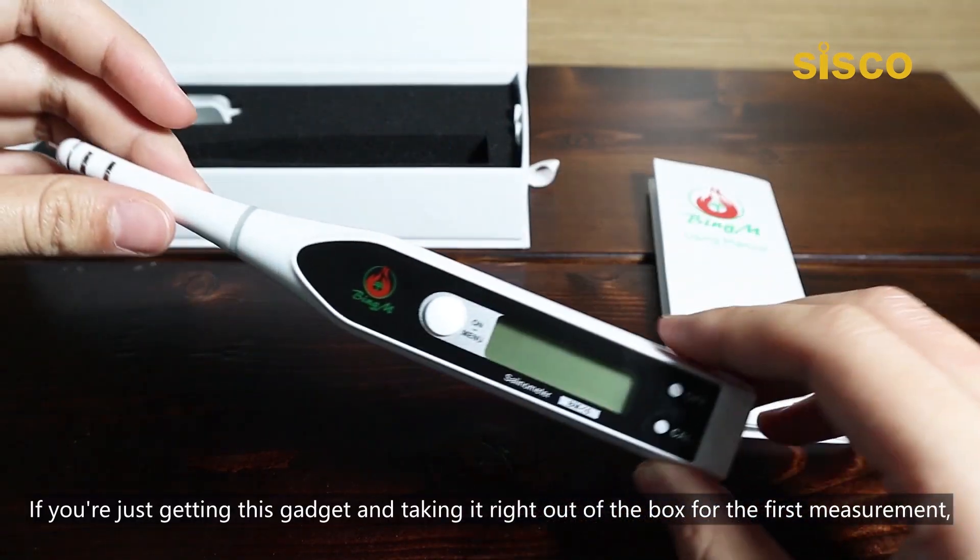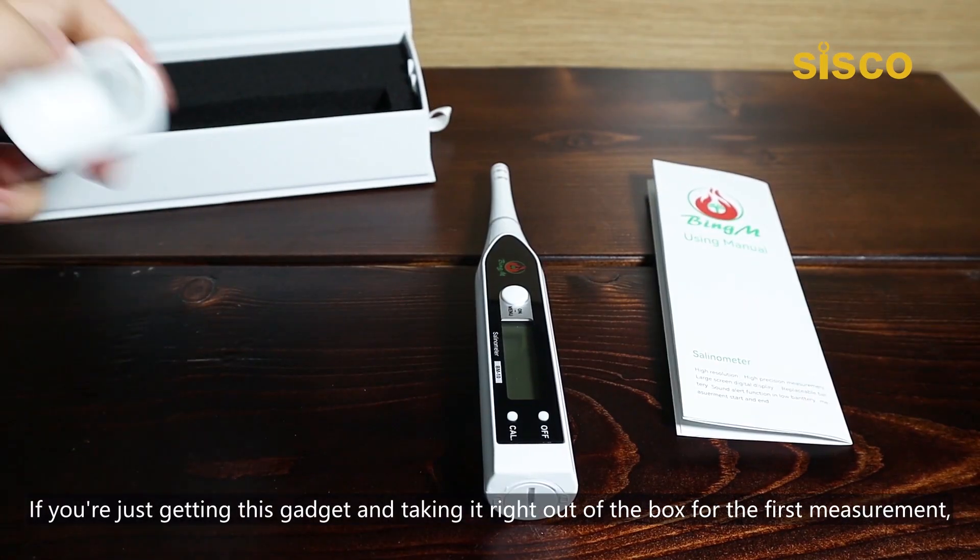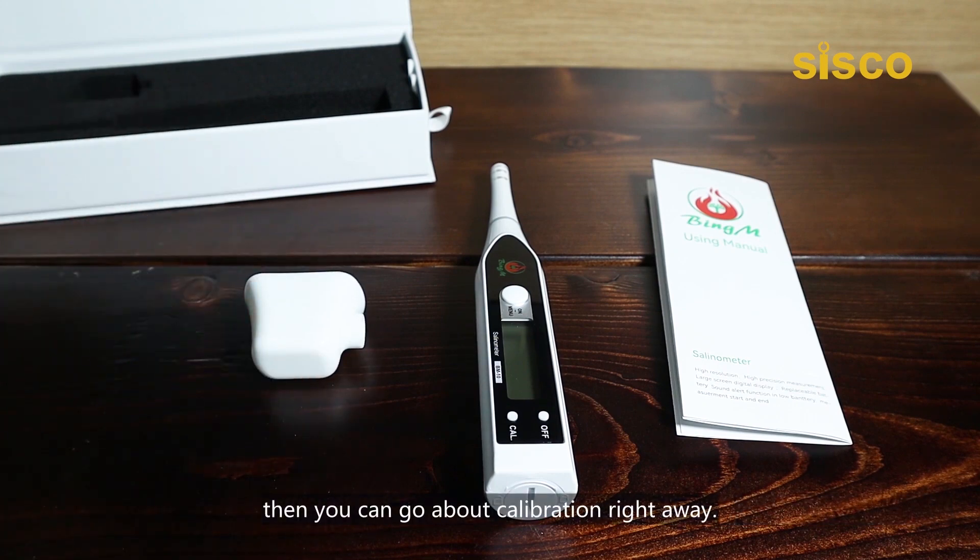If you're just getting this gadget and taking it right out of the box for the first measurement, then you can go about calibration right away.